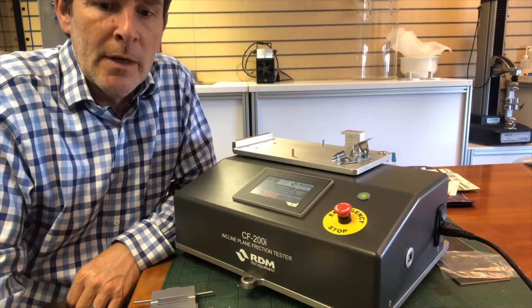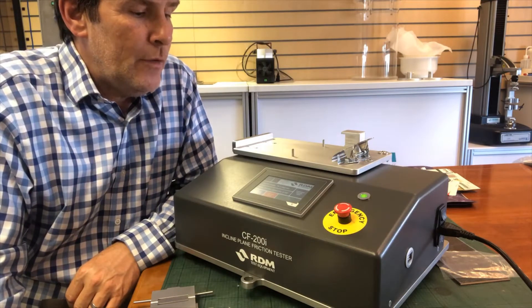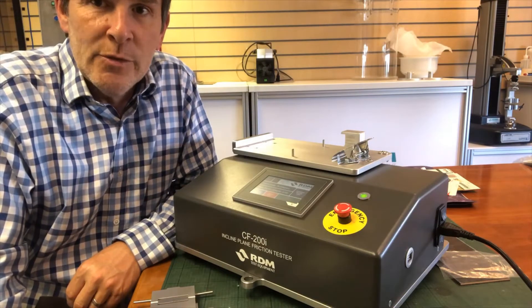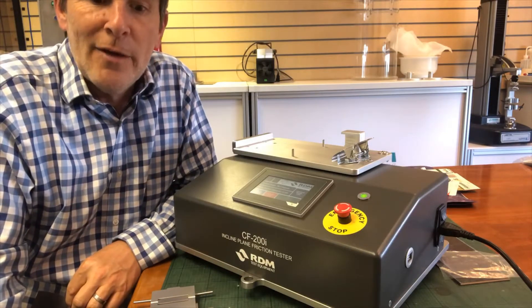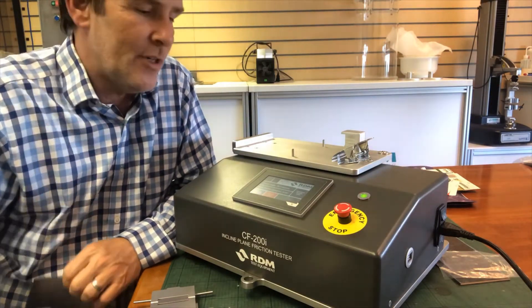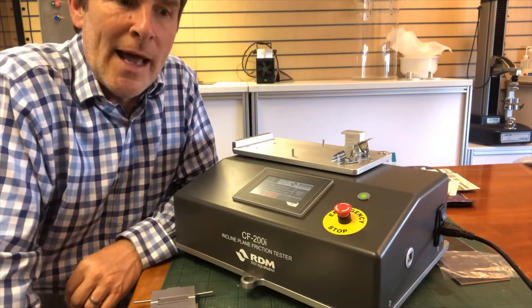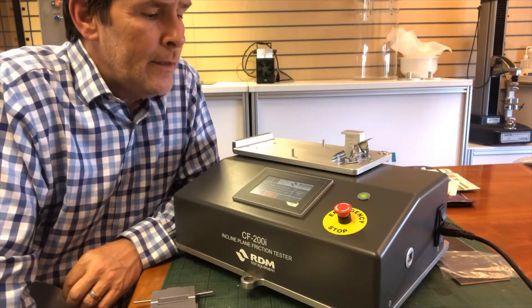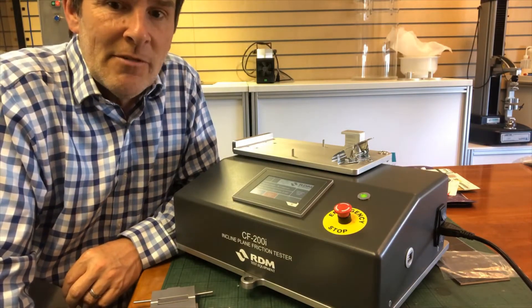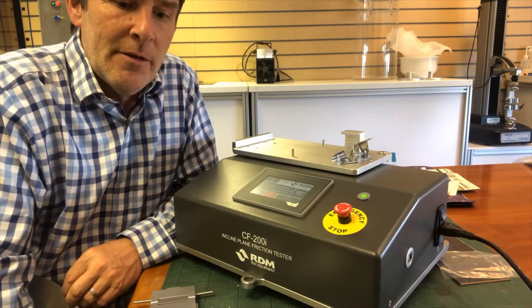The instrument measures the initial sliding friction. It gives you values for the sliding angle and also the tangent of that angle, which gives you your coefficient of static friction — generally measured as a value between zero and one, where a value closer to zero is a slippery material and a value closer to one is a stickier material.